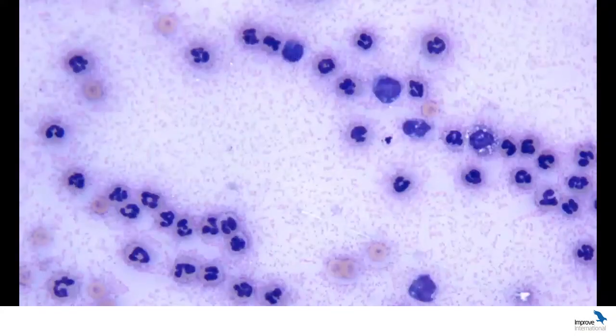Now, one of the things that I wanted to point out is that this would be very typical, and I could have this picture as a sediment exam from a fluid from a cat with FIP, and it would have a very similar picture. So lots of non-degenerate neutrophils, the proteinaceous background, and then a couple of these macrophages with vacuoles that we have here. I hope you can appreciate I'm circling a macrophage at the moment on the right-hand side of the screen.